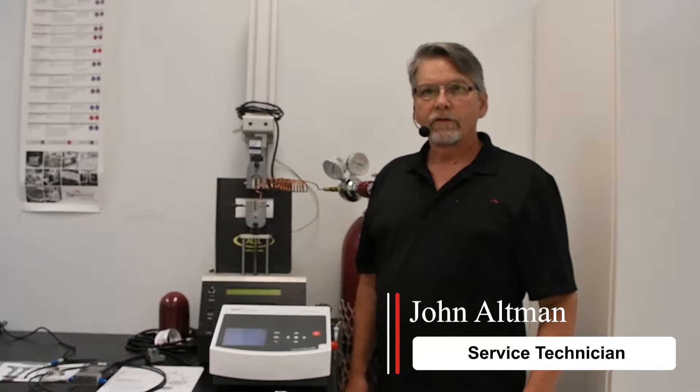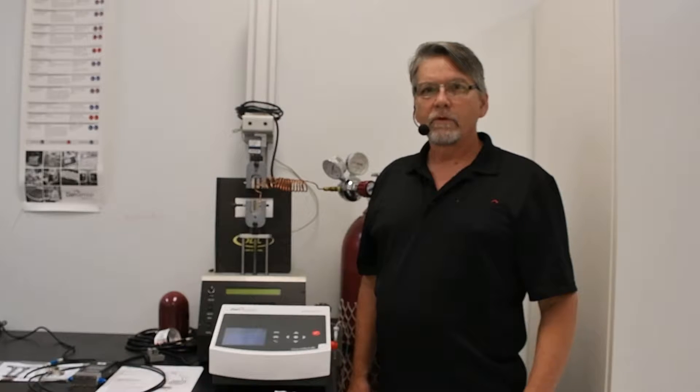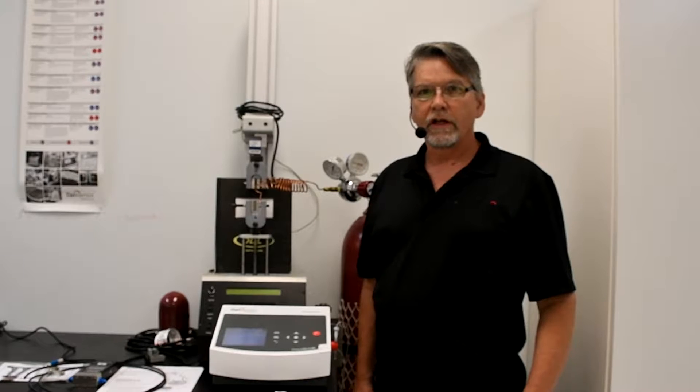Hello, my name is John Altman, service technician at MoCon. Today we'll cover the field verification process for your Checkmate 3.